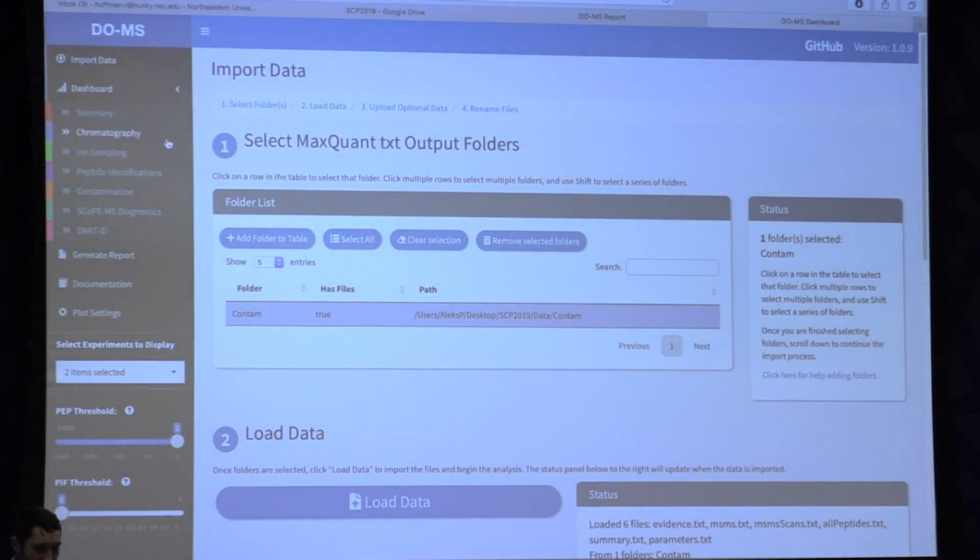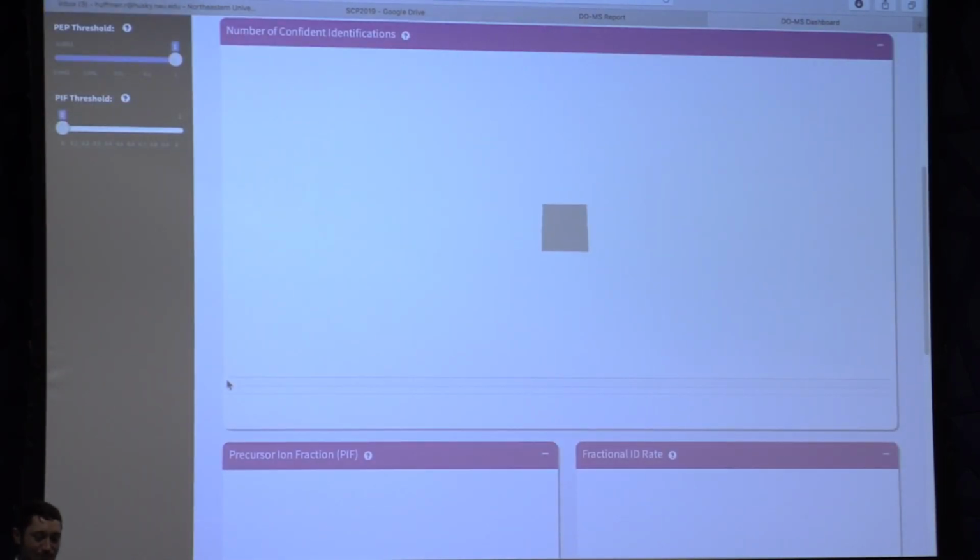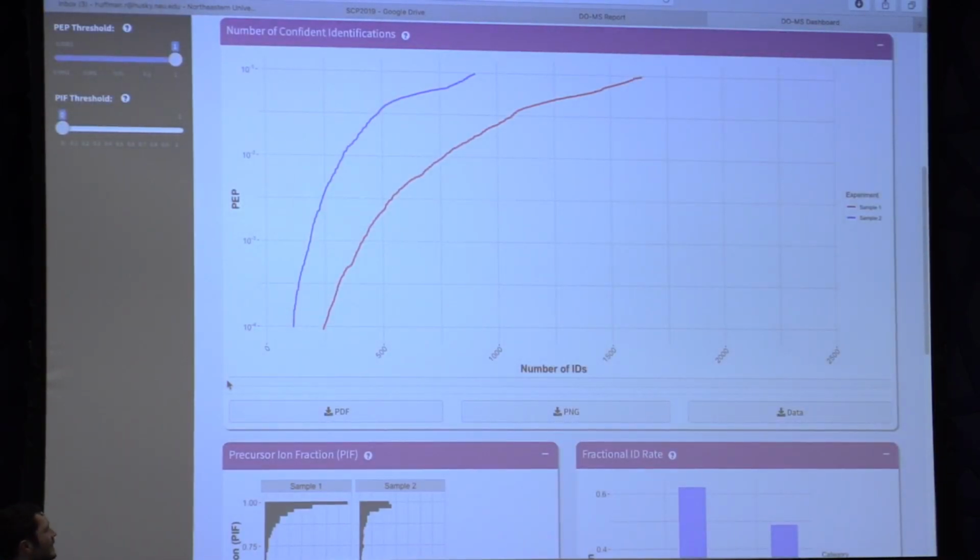Now, once we've updated our labels, perhaps the first place most people run to after they've done an experiment is to see how many peptides did I quantify. So we'll go to the Peptide Identifications tab. And what we see is, between these two replicate injections of 100x master sample, we have wildly divergent results. In one case, we're identifying about 750 peptides at a PEP of 0.01. In another case, we're identifying perhaps maybe around 300. Now, these are replicate injections, so what went wrong?